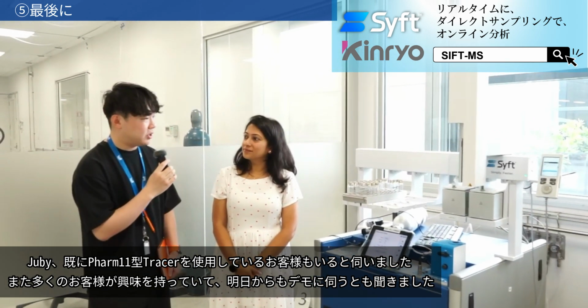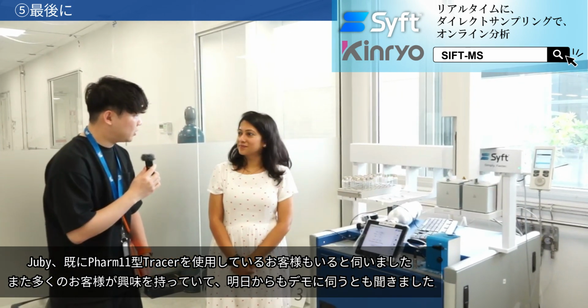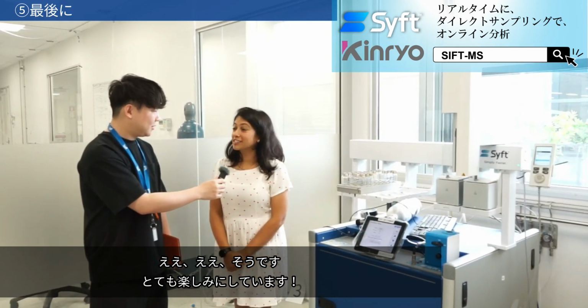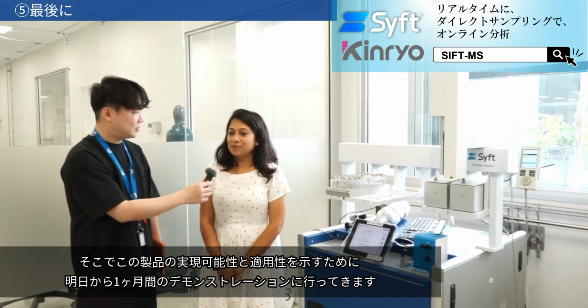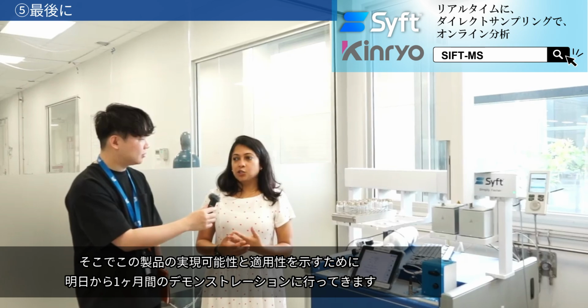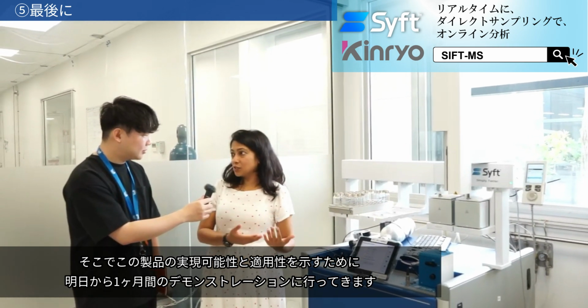So Juby, I know we already have a few customers using the Pharm11 Tracer, and we have many customers interested, and you're going to do some demos starting tomorrow? Yeah, absolutely. I'm really excited for that. So I am going for a month-long demonstration where I would be showing the feasibility and applicability of this product.